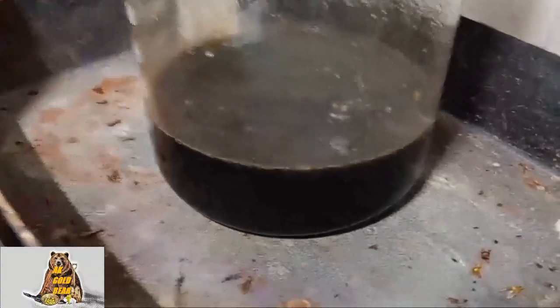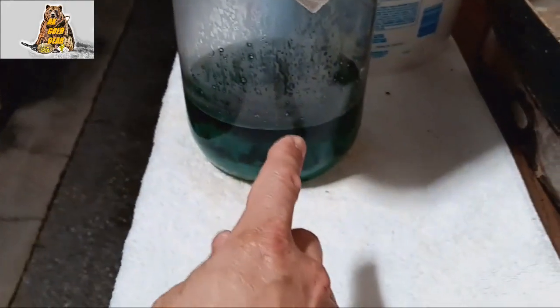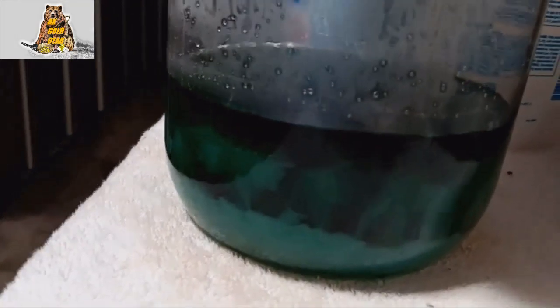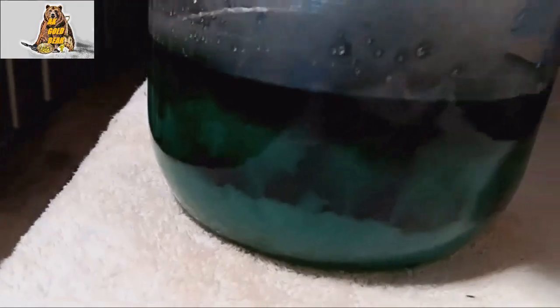The dissolution reaction is over now I can filter it. It's already dark outside, a lot of insects. My goodness. Four hours ago I filtered the solution and check this out, in the jar I'm already have some crystals of ferrous sulfate looking good.